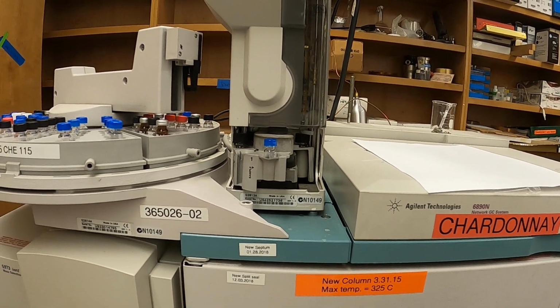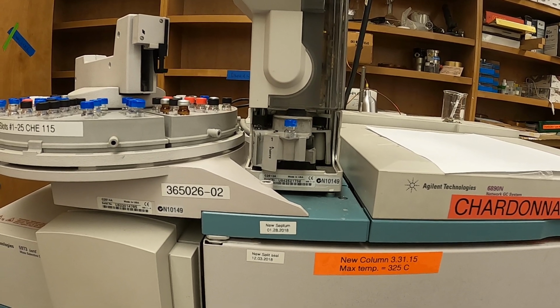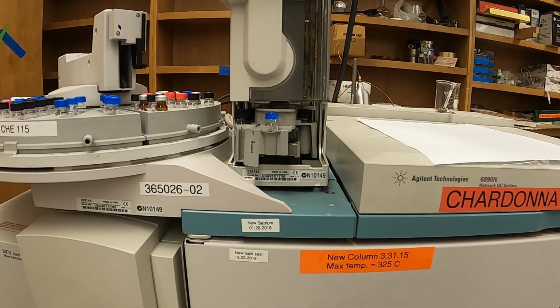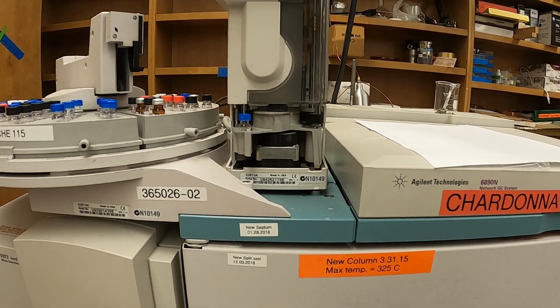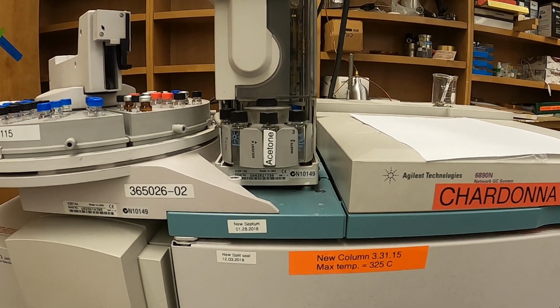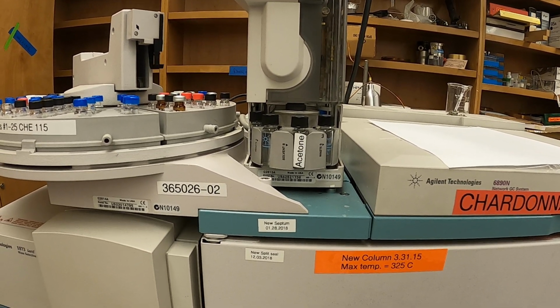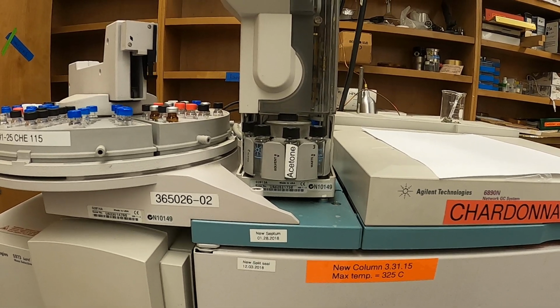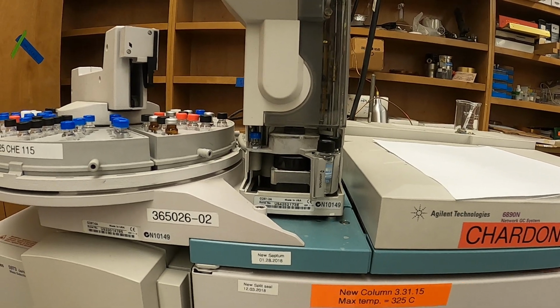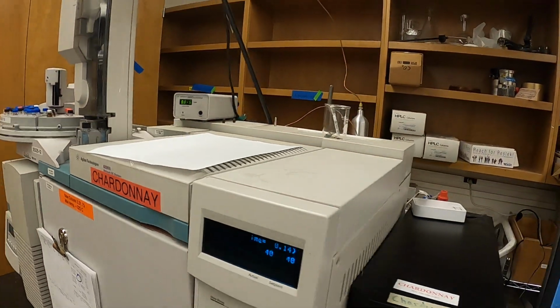So we're going to do 3 pre-rinses. Here's the third one. And it's going to take just a tiny volume from standard 4, 0.2 microliter. We do 1 pump. Really, if we just did that pump and then sucked up air and injected it, we would still get a significant abundance. So everything's going well.